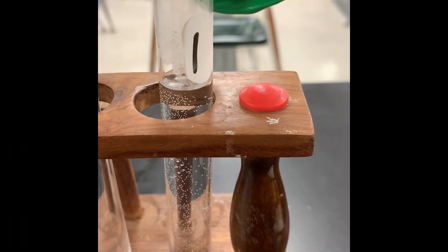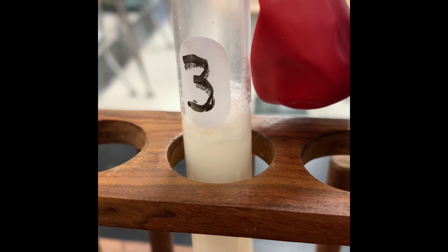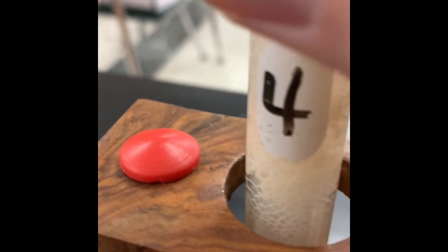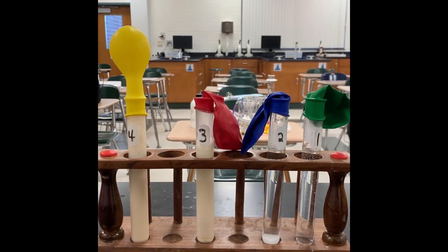We're back for our day two observations. We got back in the lab — this may look a little different, but everything's identical. Final observations for test tubes one through four: Test tube one — still water, balloon not inflated. Test tube two — water with sugar settled, balloon not inflated. Test tube three — a small amount of bubbles, balloon not inflated. Test tube four — there's a large amount of bubbles happening inside, and look at this balloon — it's inflated! That means there must be some type of gas in there.